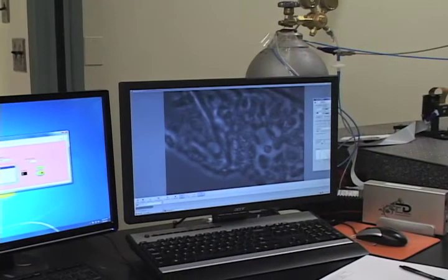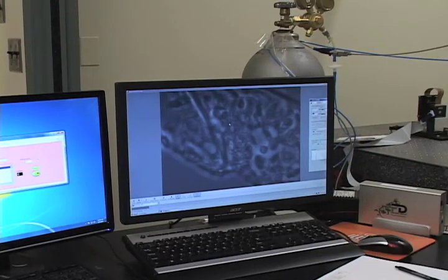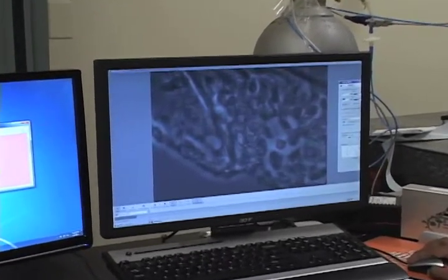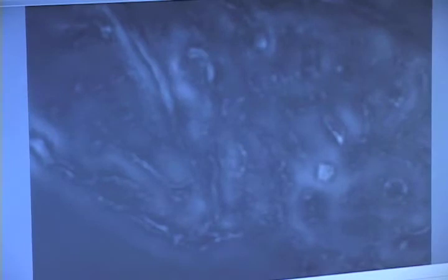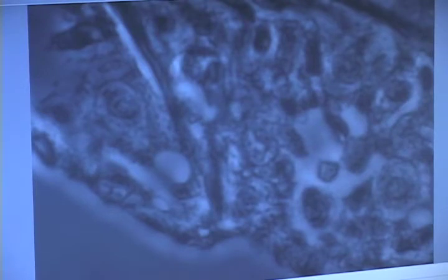So I have the SLM running and I have the camera synchronized with the computer now. Let me just adjust the focus here. When I snap an image now, it'll shift the phase between the scattered and unscattered light by pi/2. So this is phase contrast. This is the next pi/2 incrementation, the next pi/2 incrementation, and our third one, and finally back to phase contrast. From these four intensity maps, we can uniquely determine the quantitative phase shift at each pixel, which we do using a MATLAB script.